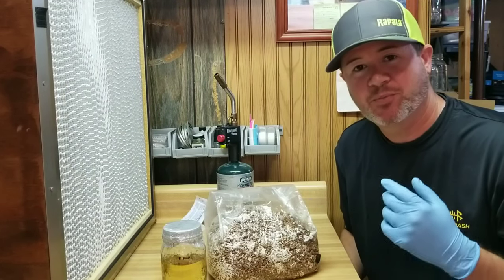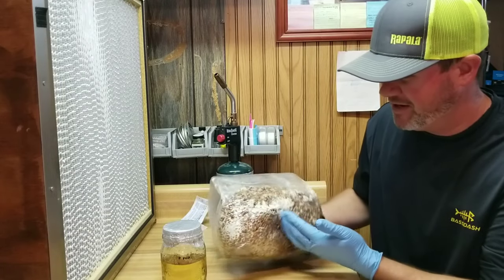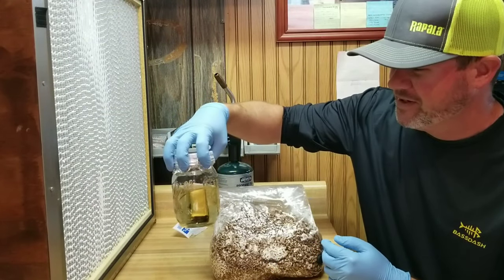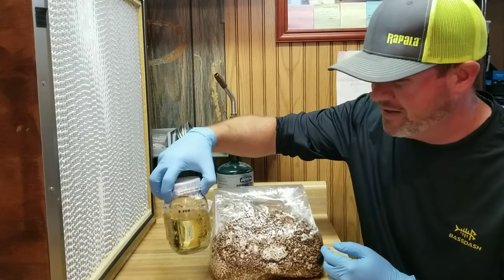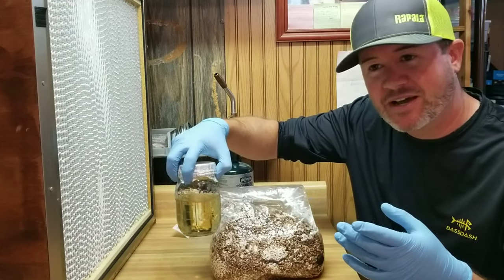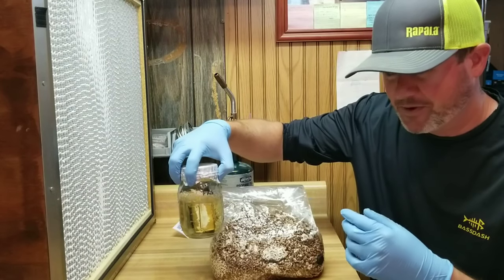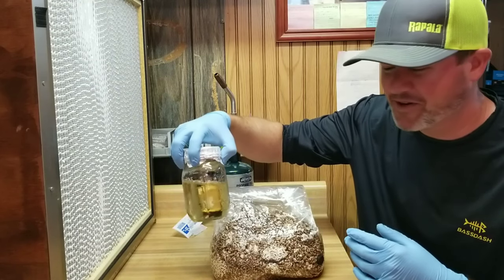That's it guys, we are all set — pretty quick and painless. For about $30 I've got a bunch of grain spawn ready to use to get an oyster grow going and a nice liquid culture jar. I'm going to let this grow out for two to three weeks and I'll keep you guys updated. I only got maybe 5–7cc back out of the bag, but when I held it up to the light it was full of little bits of mycelium. Since it's an oyster they grow like crazy, so in two to three weeks this jar should be full of mycelium.